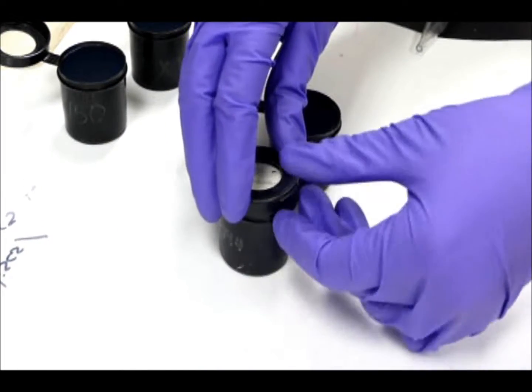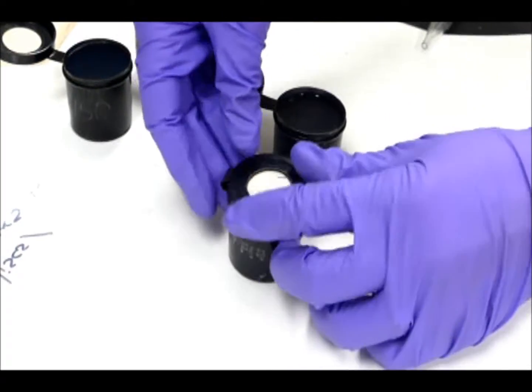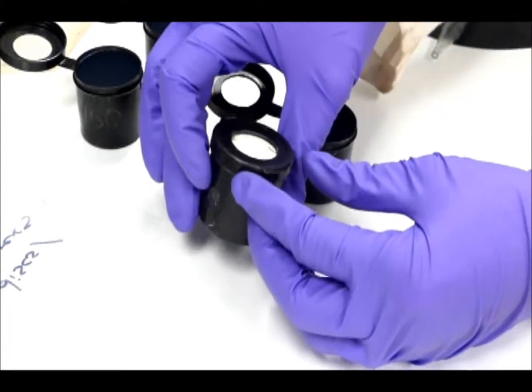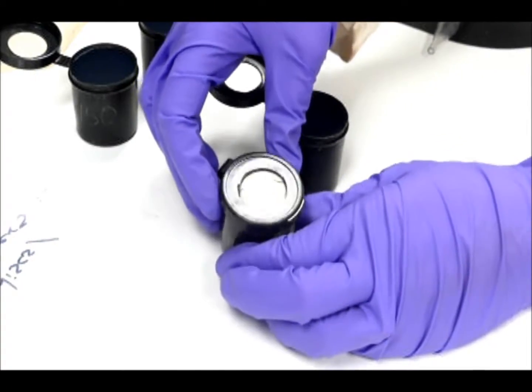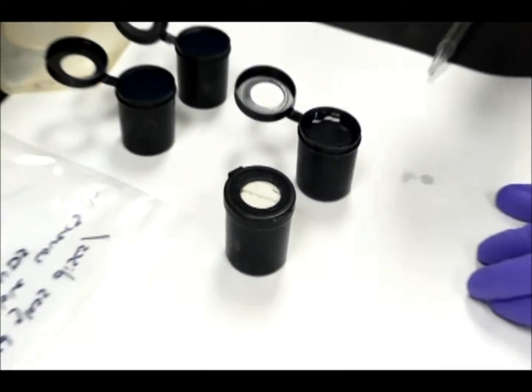So I'm going to stick the lid on now. You can see that my disc isn't moving and it's pretty firmly in there, and I didn't have excess agar gel. It's not coming out of the sides. And now it's ready to be deployed into your stream or river, and we can let the bacteria grow in it.